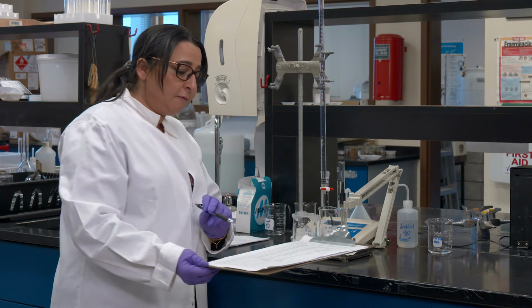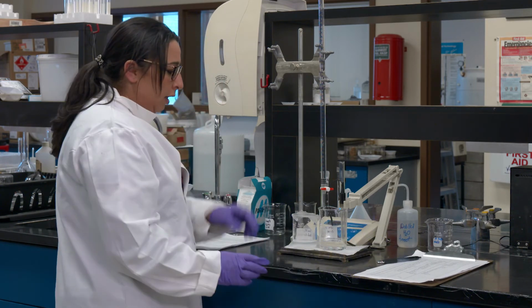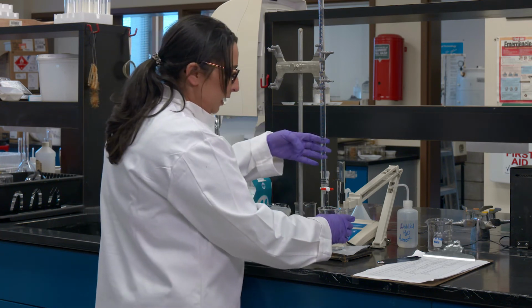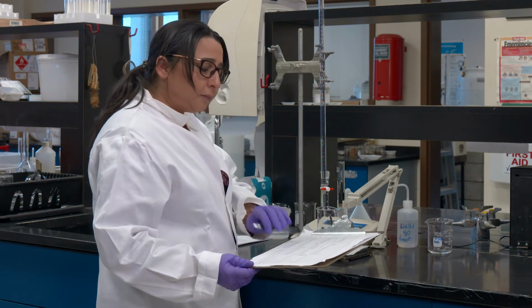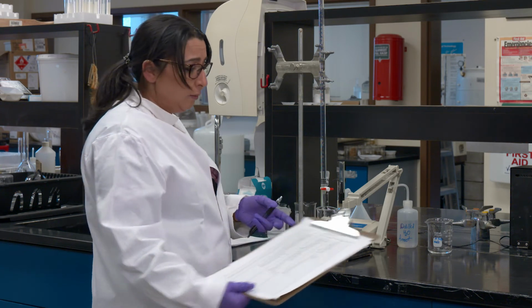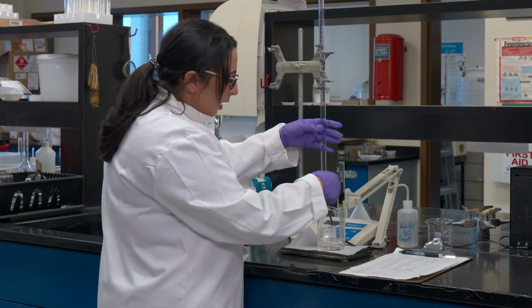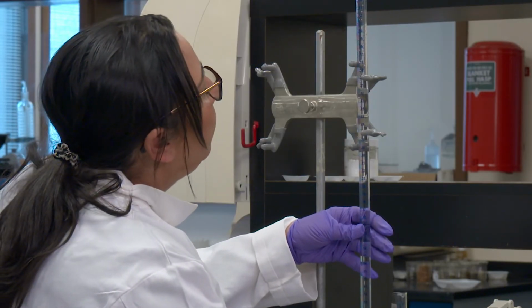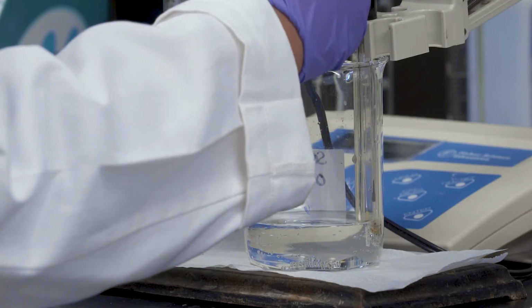I'm at 5.7, so I will continue going, adding 1 ml more, and take the readings. So another thing to pinpoint is I have added 30 ml of the burette solution, which is the sulfuric acid, so far. So 30 ml. Looks like it might take another 10 ml. That's my guess. So continuing the same process as before, another ml. Stir, stir, stir, and then let the pH meter do its job.